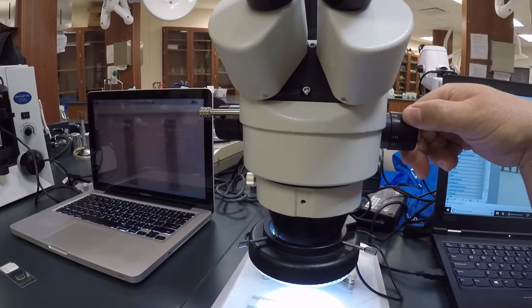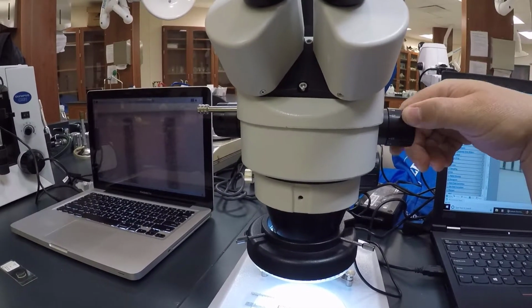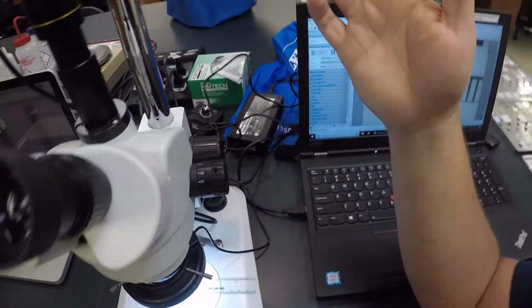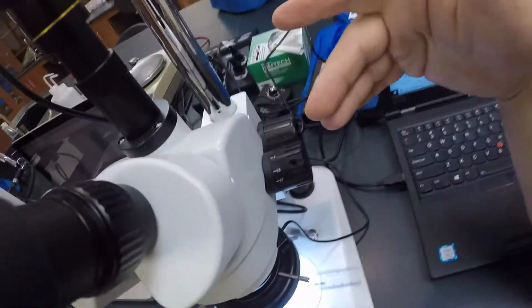And if I do about a half turn, or a little halfway in between the next two numbers, so it's 0.8 and 1, so halfway in between that would be 9 times your eyesight. You can go to 1, 10 times your eyesight, etc.